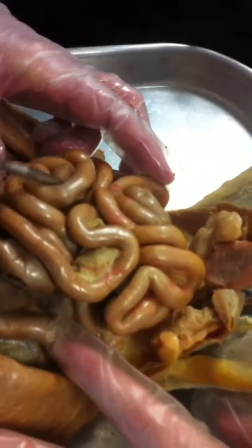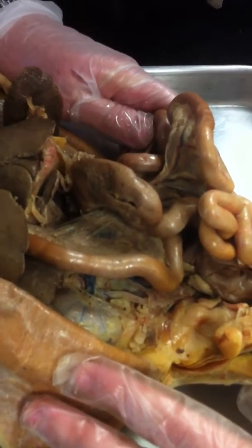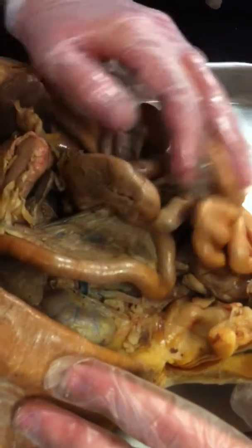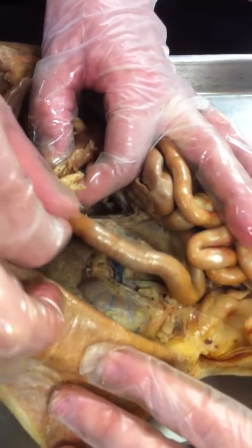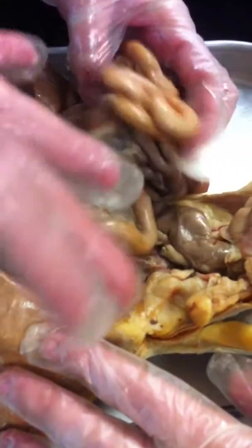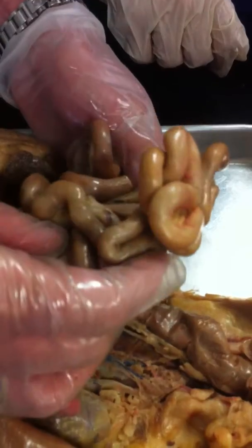Small intestine. And this is all small intestine. As far as parts of the small intestine, there are three parts, as you might remember. The first part's the duodenum, then there's the jejunum, and then there's the ileum. You can't really tell what's what, but you can tell the part here coming from the stomach, the pyloric region of the stomach. This part right here is going to be the duodenum, and it turns into the jejunum somewhere along here. So we don't even have that on the list. And you can tell that the part toward the end is going to be ileum. Most of the intestine is considered ileum.